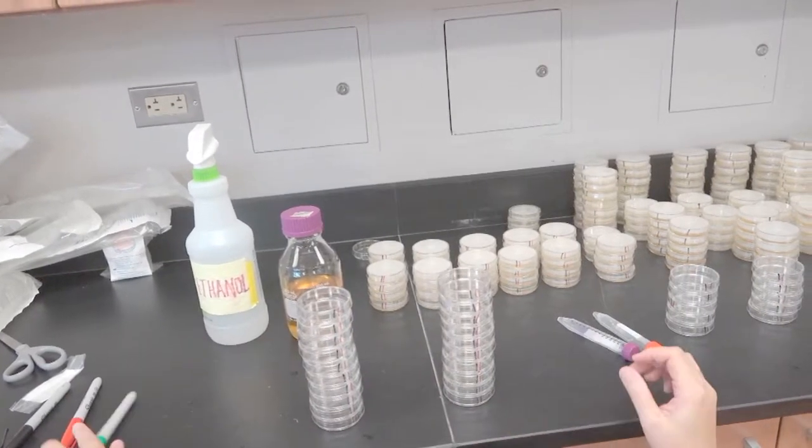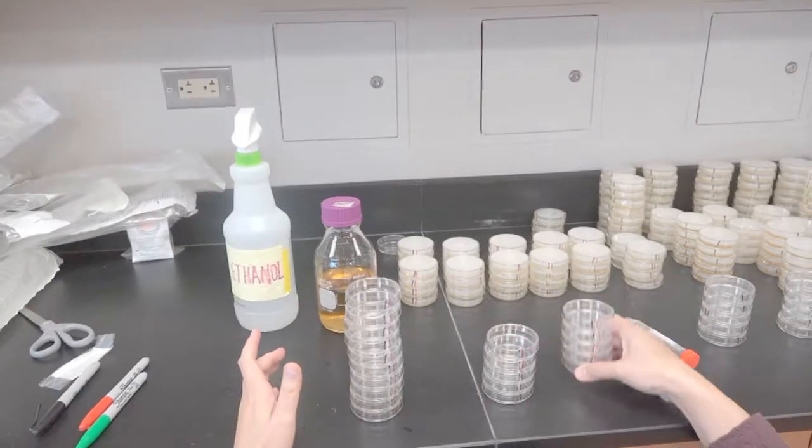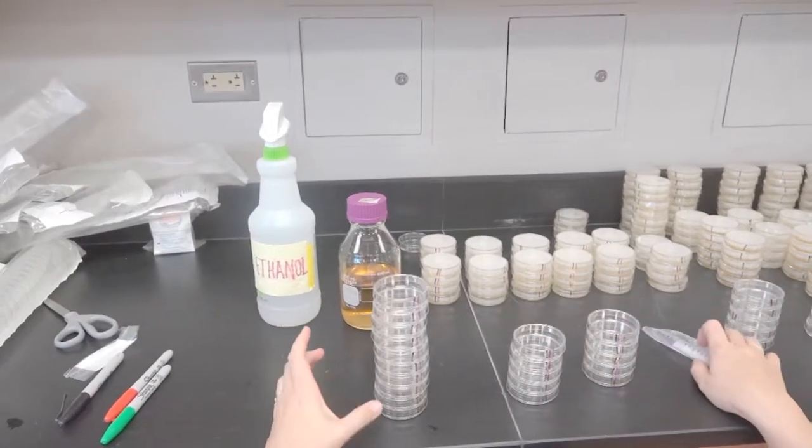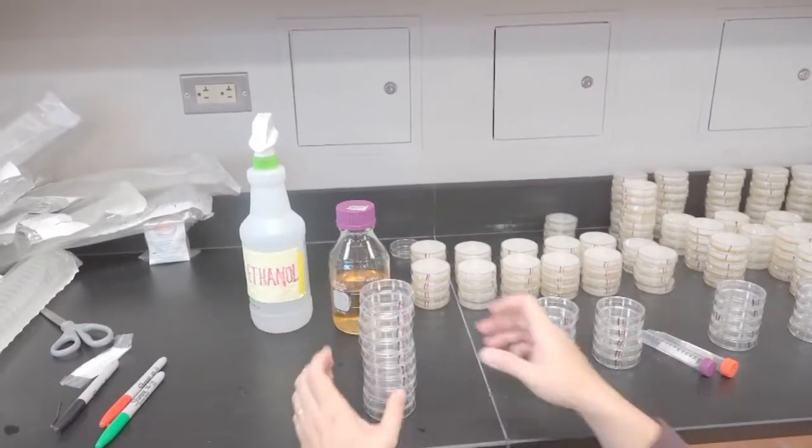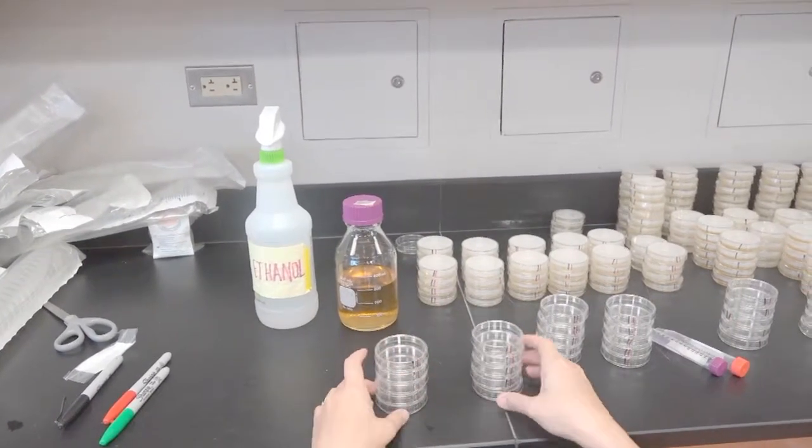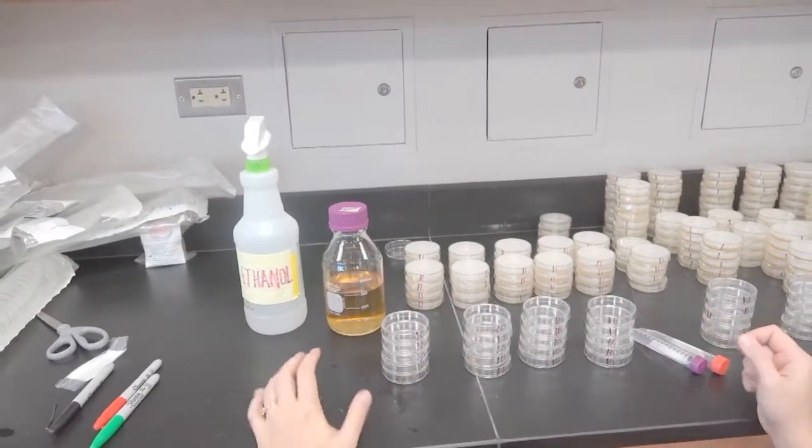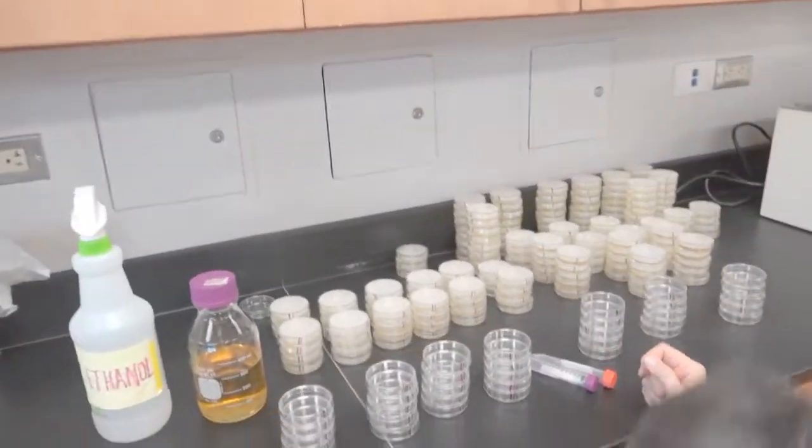Now I like to separate them into shorter stacks for pouring. This time I'm going to separate them into stacks of five. Sometimes when people have bigger hands, they might be able to stack them in a higher amount. I usually like to work with four, but five is fine too.